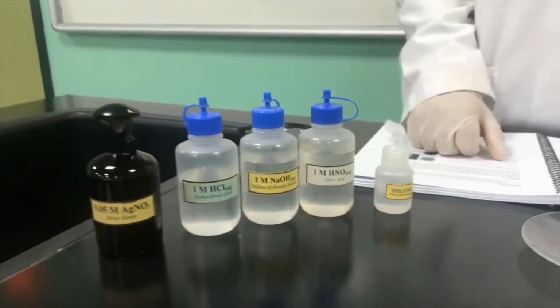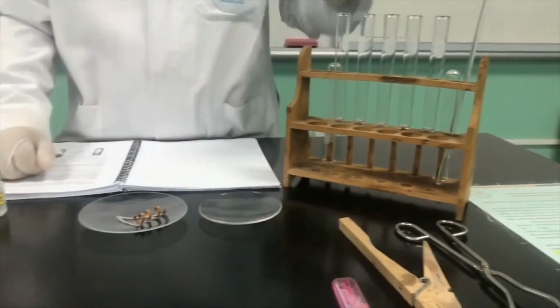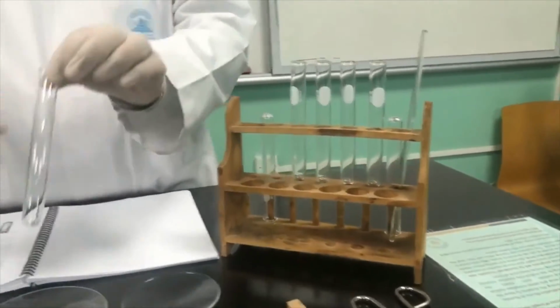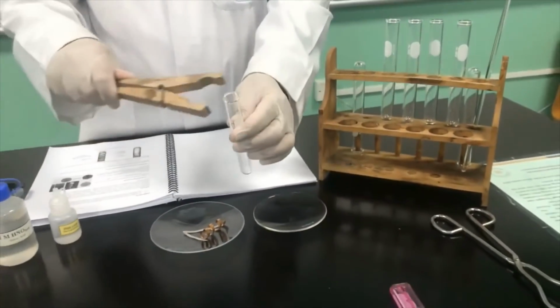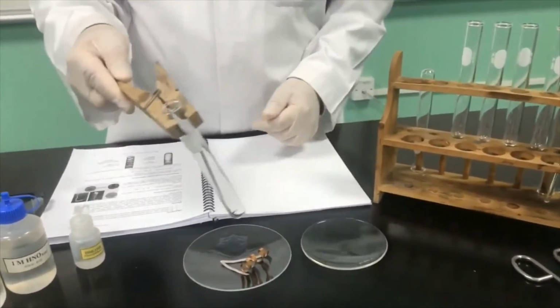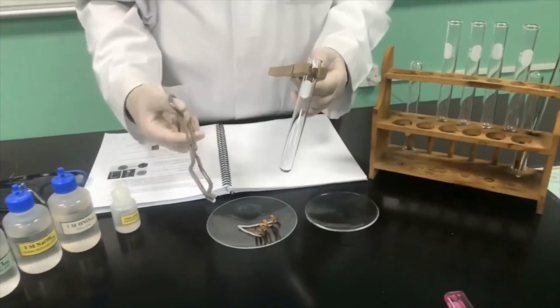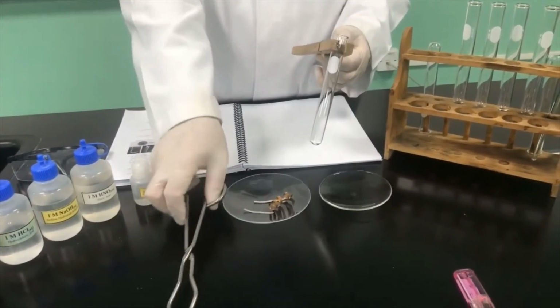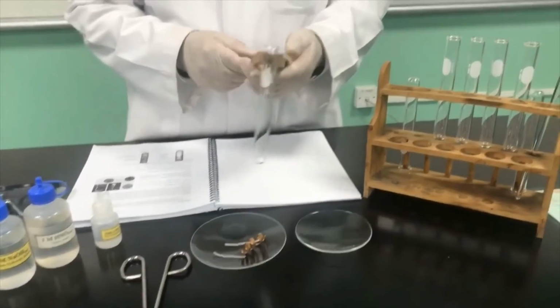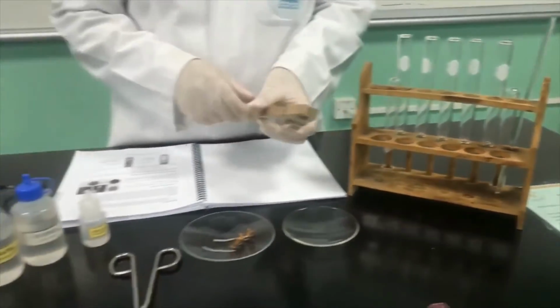And regarding the glassware, mostly we're going to use a test tube, a simple one, and the test tube holder. We use this one simply by holding the tube like that, right? And we use the clipper here to hold the ribbon during the performance of chemical reactions. So we will start first with the experiment with chemical reaction number 1.